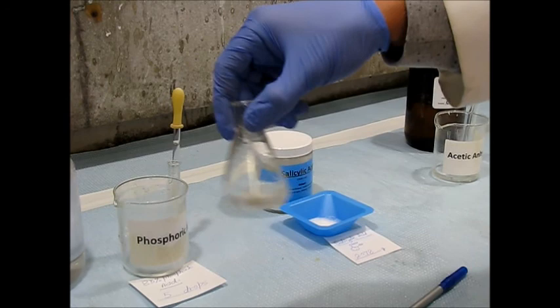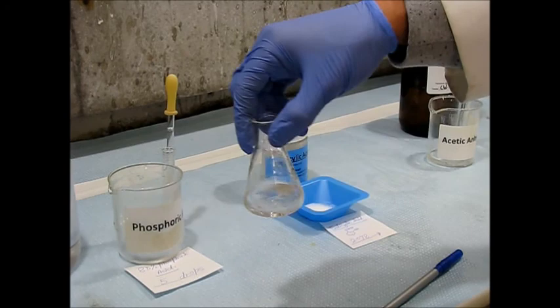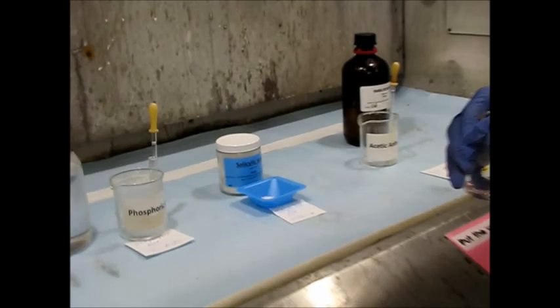So once all these potentially corrosive vapors kind of get out, we'll go ahead and move this onto our stir plate. Should be good now.